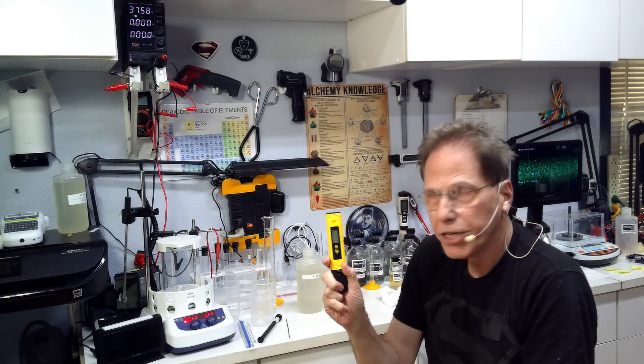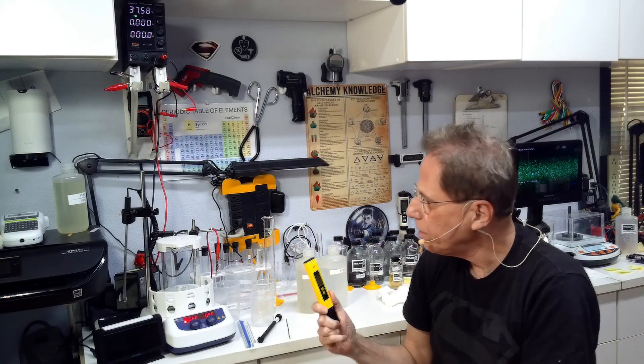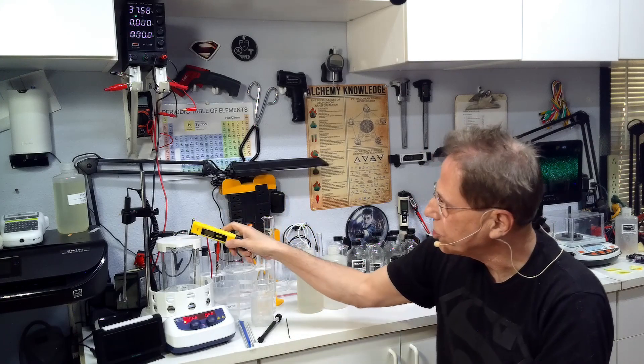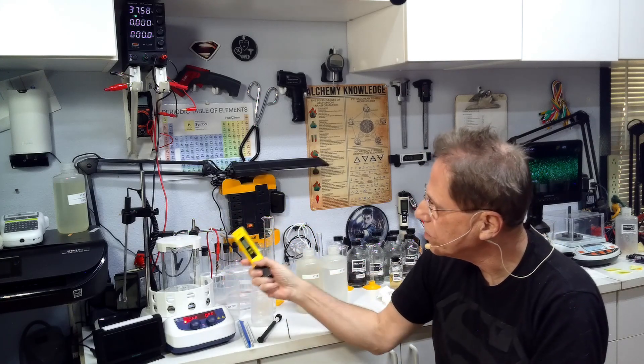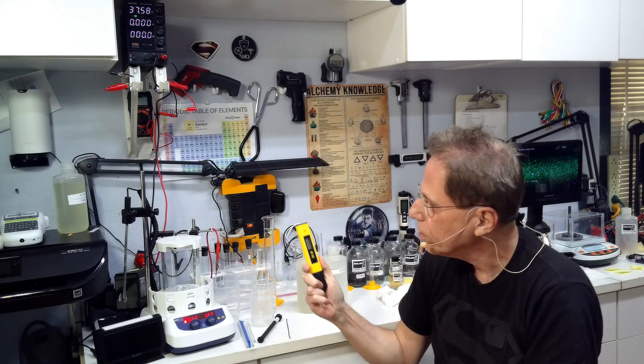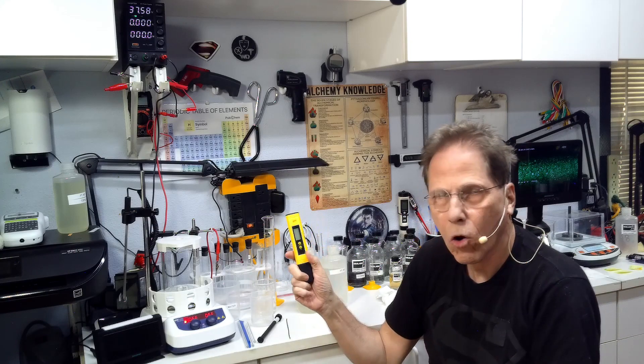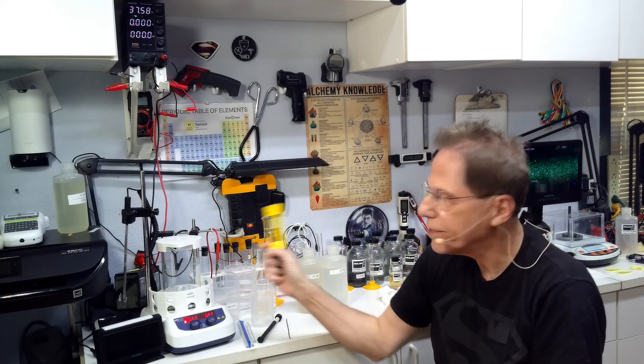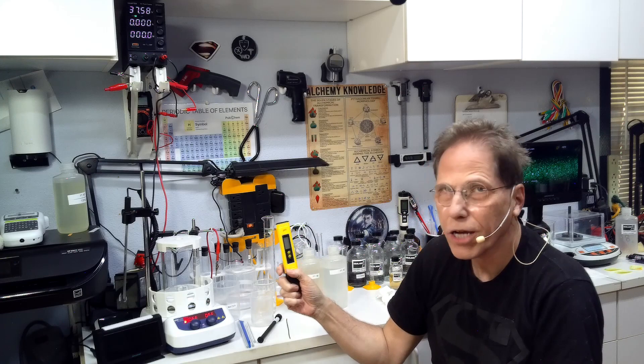If you're boiling away the fluid, you're going to be having to put an awful lot of fluid in over a short period of time to replace what's boiling off. So I try and cook it at 80 degrees C that way the boiling is not going crazy. You're going to need a pH meter. Now you're going to need the pH meter to set the pH initially. The pH in this is going to have to be over 10. We're going to make it 10.75 pH because that's as high as I can make it.